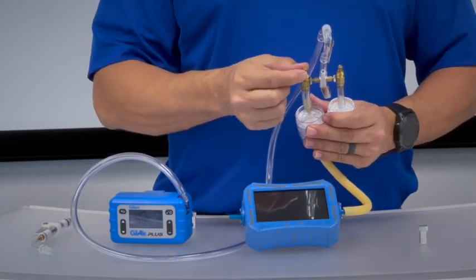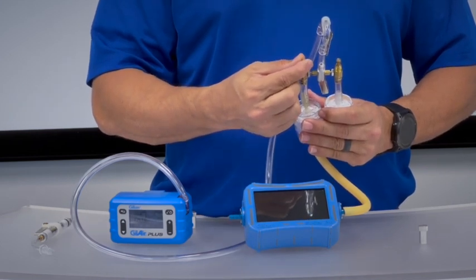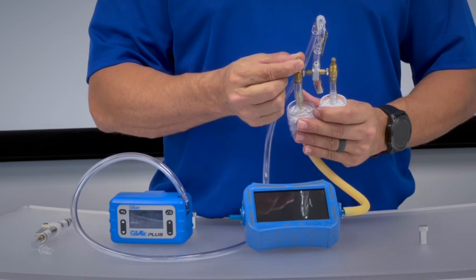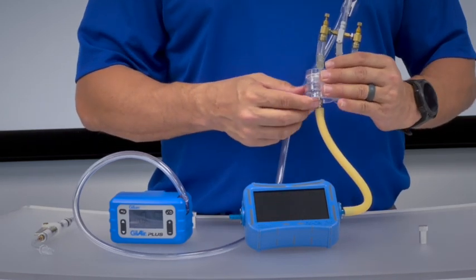Underneath the cap we have set screws. These set screws can be adjusted clockwise to decrease the flow and counterclockwise to increase the flow. On the bottom side of the cassettes there will be a fitting that will attach the tubing to the calibrator.